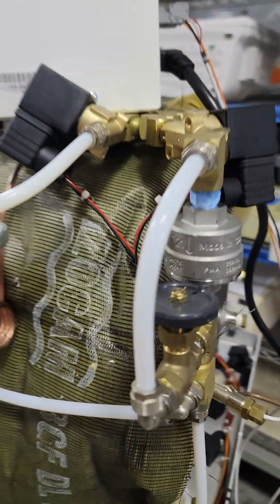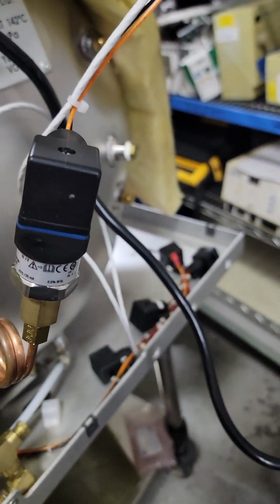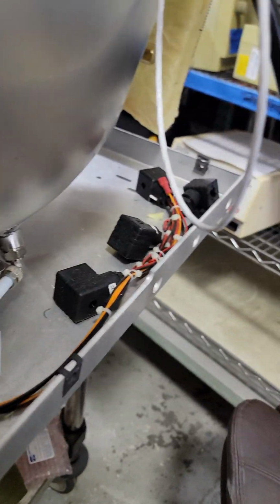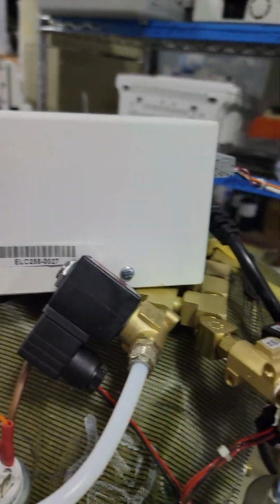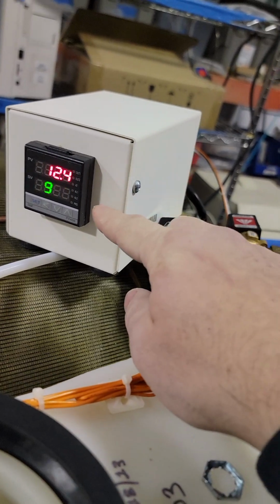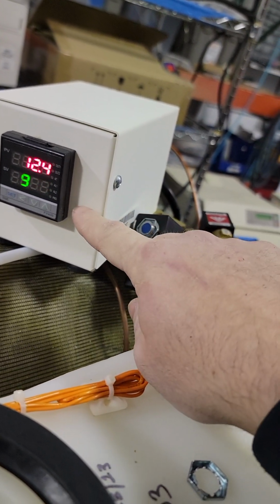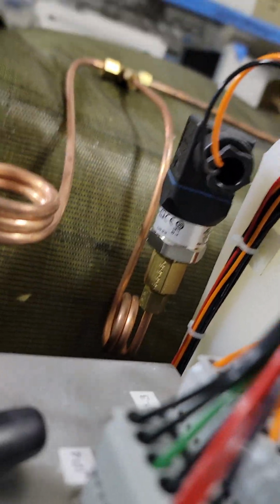Back end, you notice a few more valves, needle valve, bellows. There's a test kit. Anyway, there are much more features that this one I guess doesn't have. I don't know yet. This is the test block. Instead of teeing in a gauge, you got this bad boy. It reads in Celsius, and I believe this is kPa absolute pressure. So that's not in the charts, which is crazy. Here's a pressure sensor, kind of like the way Steris does it.